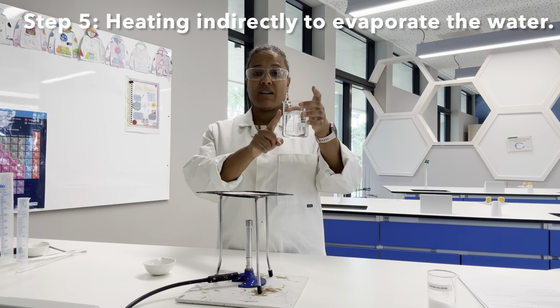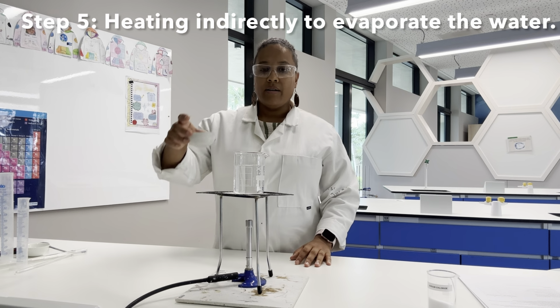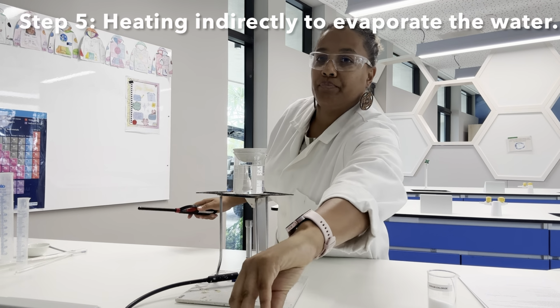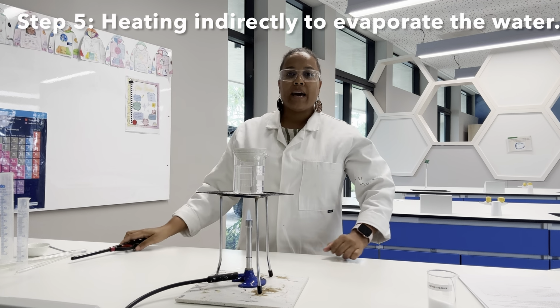So we're going to take some regular tap water in a beaker, and we are going to place our evaporating basin on top of that. What that does is create a water bath, and I'm making sure that my air hole is open.